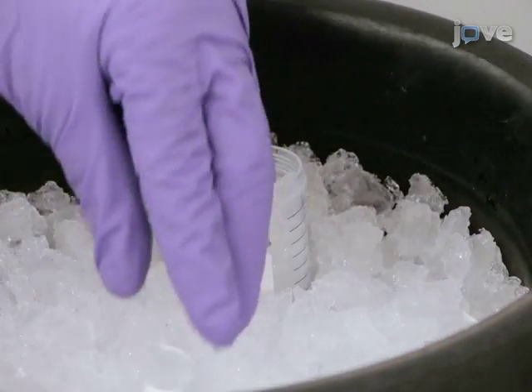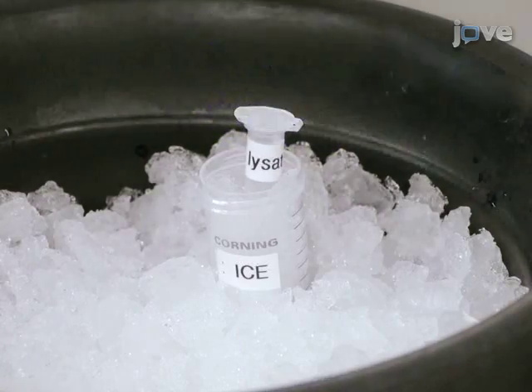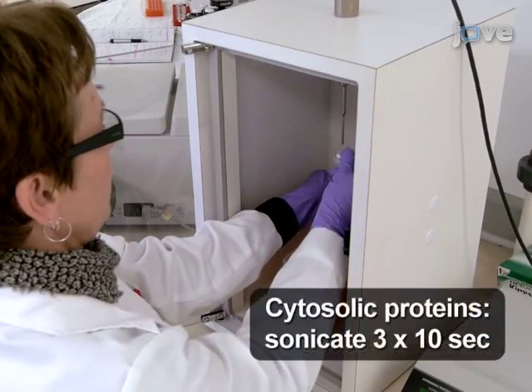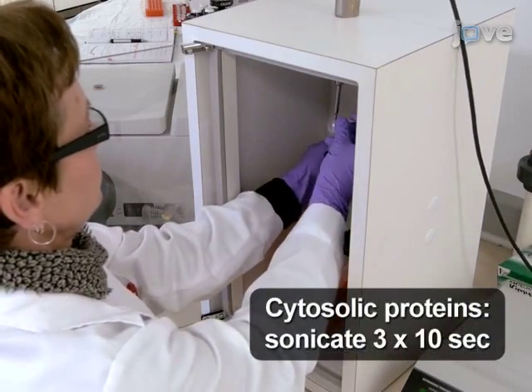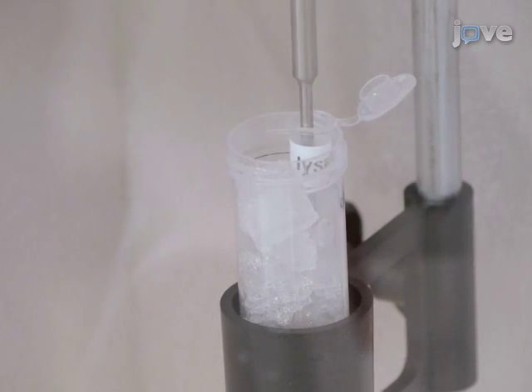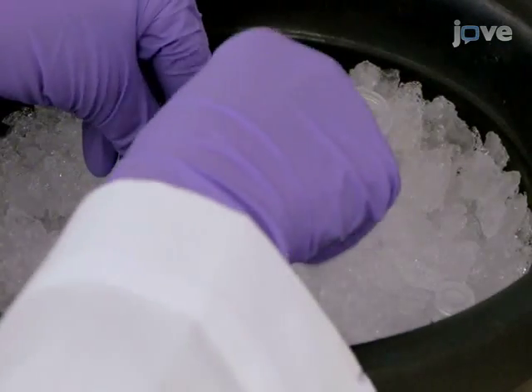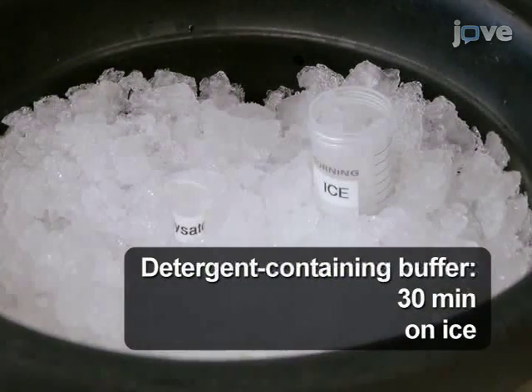For extraction of cytosolic proteins, place the cells on ice to minimize local overheating and lyse cells with 3 × 10-second pulses of sonication at 30% amplitude using a 2 to 3 mm pre-chilled tip. Keep the tip below the surface to minimize frothing. Omit this step when using detergent-containing buffer and incubate on ice for 30 minutes instead.